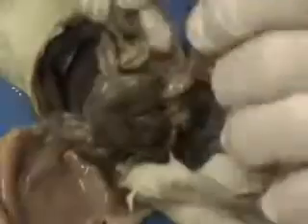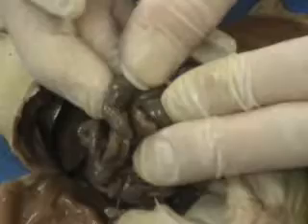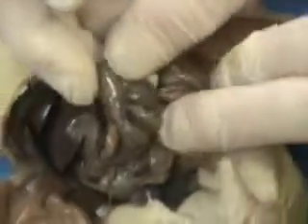Now, the large intestine comes next, and the easiest way to find the large intestine is to find this structure right here. It's called the cecum, and at the one end of it is this dead end sac called the appendix. That cecum is kind of a dividing point between small intestine and large intestine. And so if you find the cecum with the appendix, then the large intestine comes next.